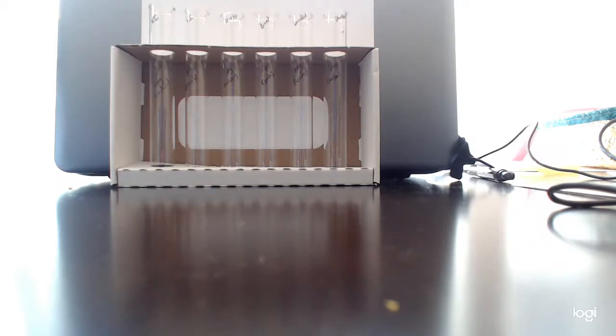Now these control experiments are experiments where we know the outcome, so we use them as a baseline or a standard for what the results should be if we know that something is negative for a biological molecule, or what something should look like if we know that it is positive for a biological molecule. So these are going to be the first set of tests for those biological molecules experiments.